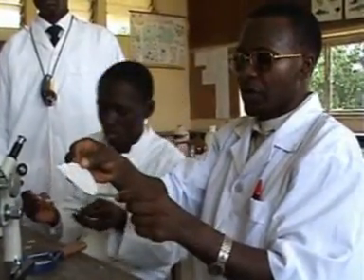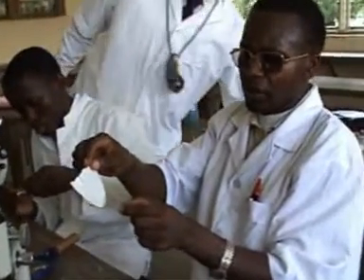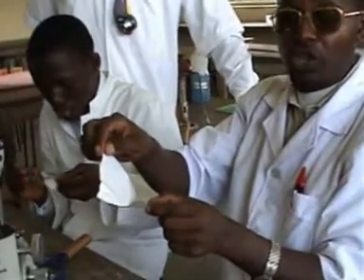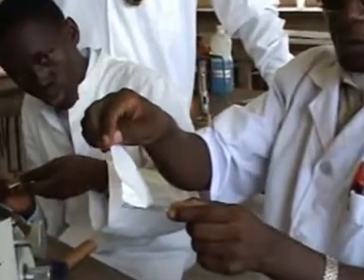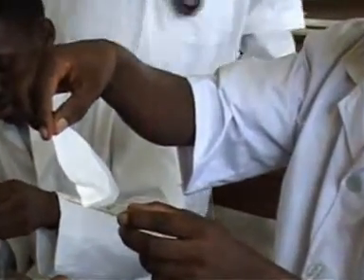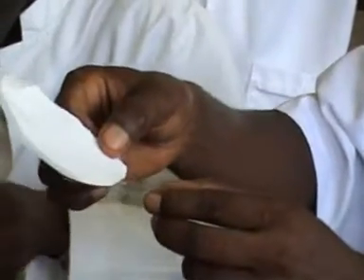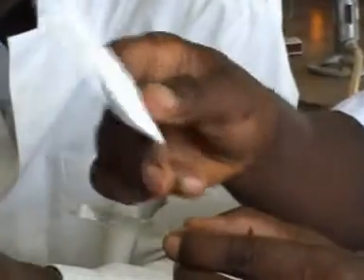So I will take the filter paper and touch the end of the cover slip. So when I touch now the end of the cover slip, you see that it is soaking up the water. All the water which was under the cover slip comes up. It draws the water up, and eventually, as long as I leave the filter paper there, it will continue to draw up the water until the water is finished. You can see how the filter paper is changing its color because it is absorbing the water from under the cover slip.